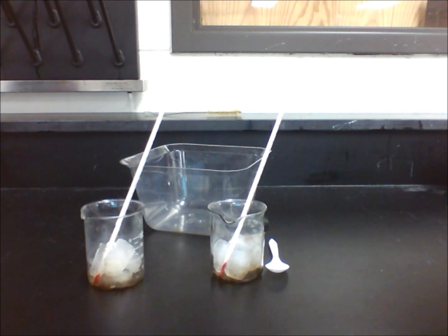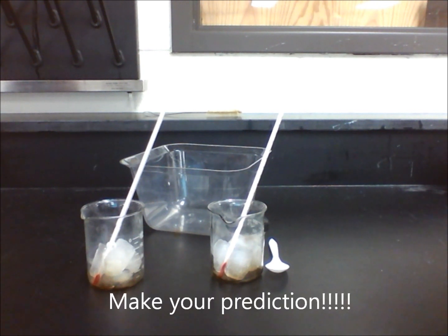What do you think will happen when two spoonfuls of salt are added to the ice in beaker A only? Make your predictions before proceeding on with the next step.